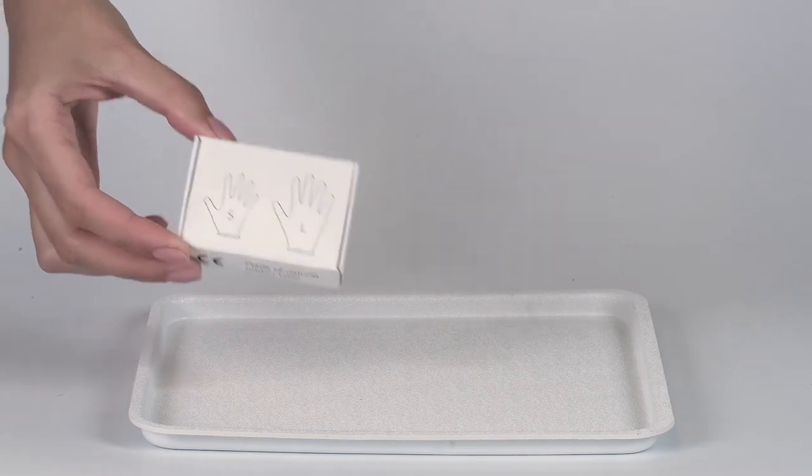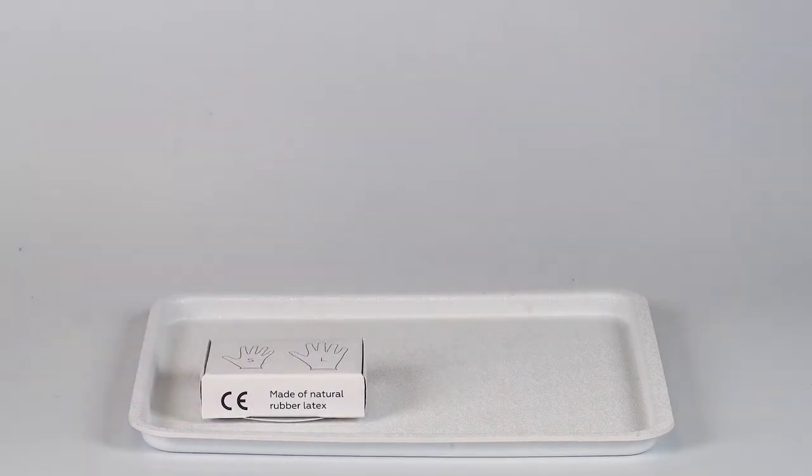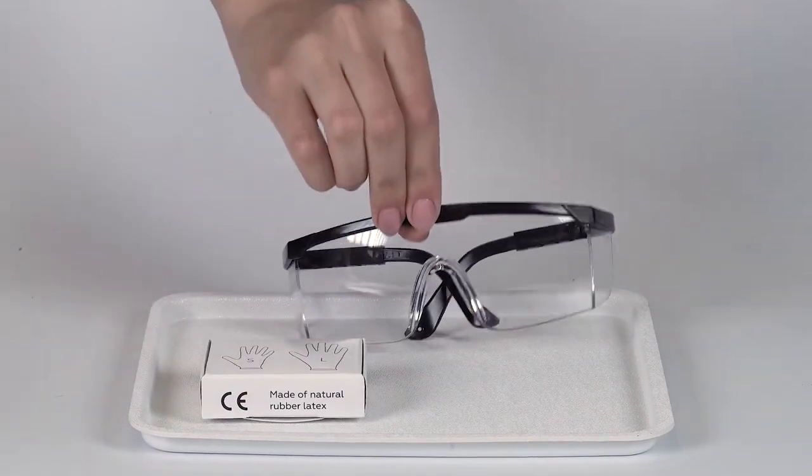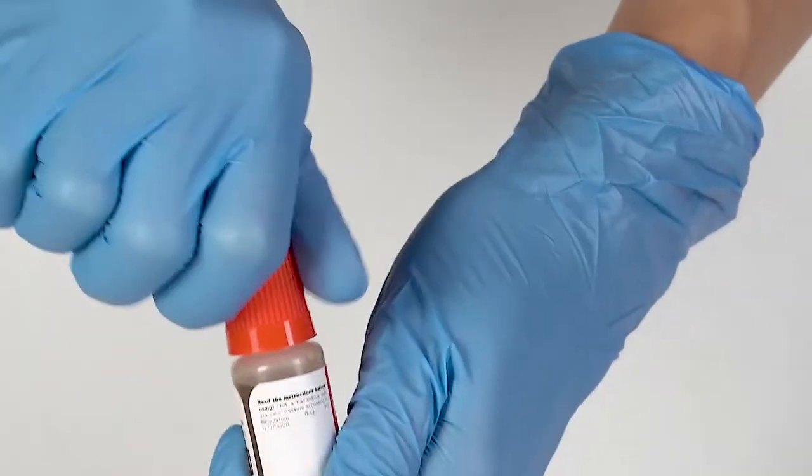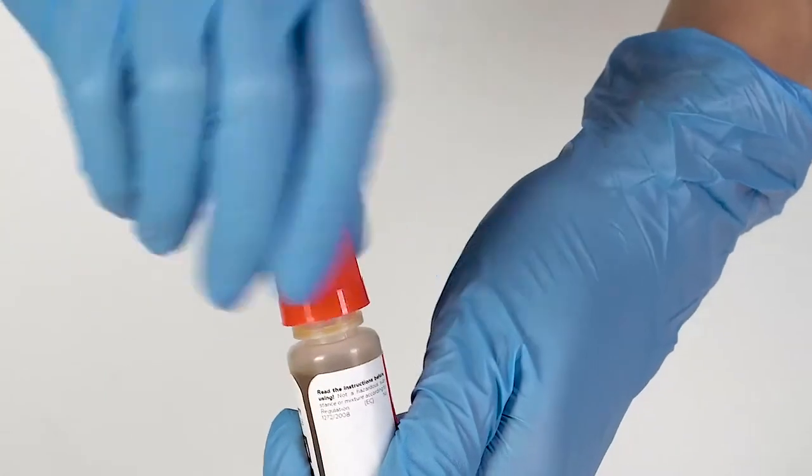Perform this experiment on a plastic tray to contain any possible spills. Don't forget to put on safety glasses before doing the experiment. We also recommend performing this experiment in protective gloves.